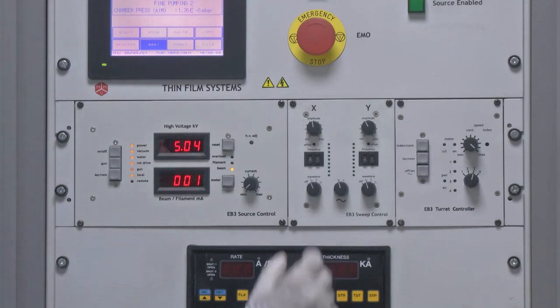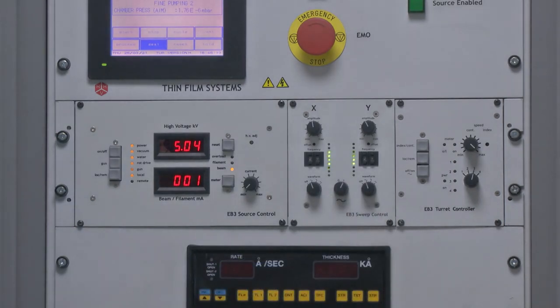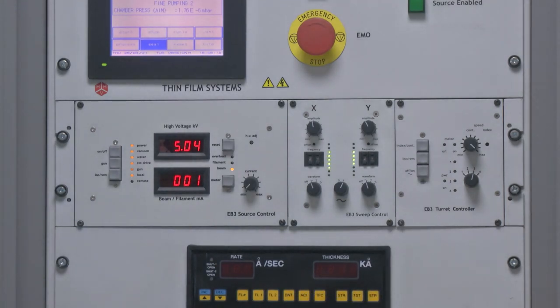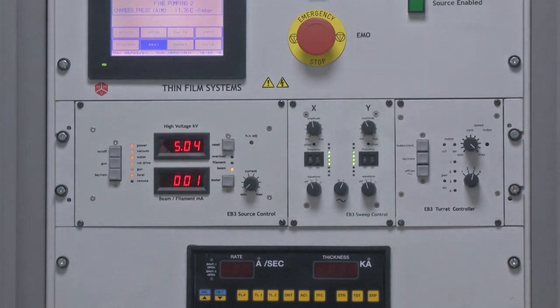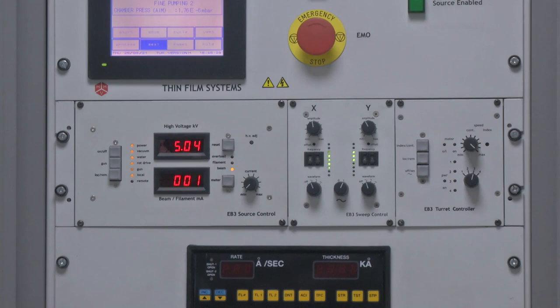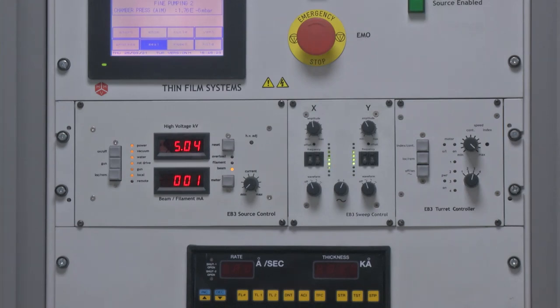The next step is to turn on the amplitude, which refers to the current amplitude. This also defines the shape of the electron beam incident on the material to be deposited — it can either be a spot beam, sinusoidal, or square beam. These kinds of functions are available in the control panel.